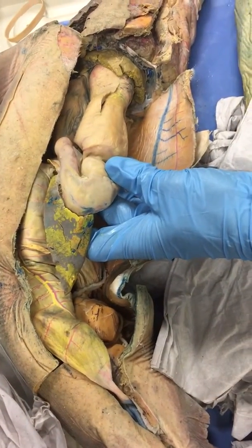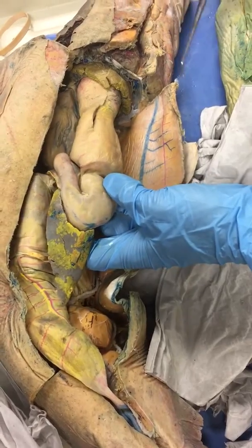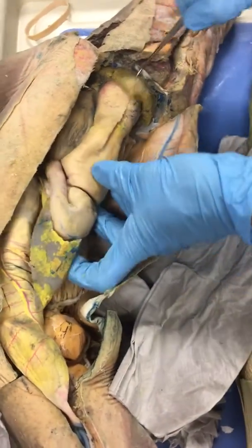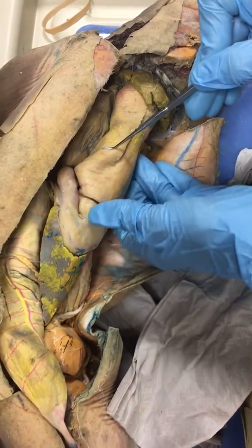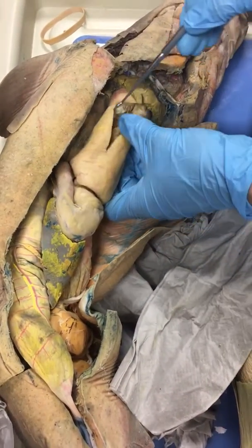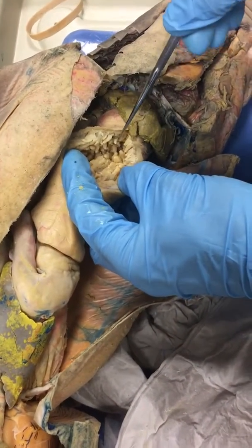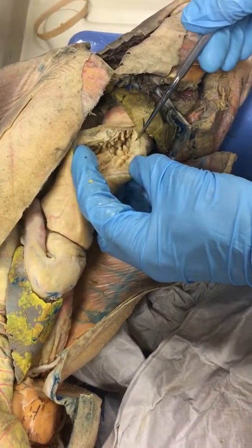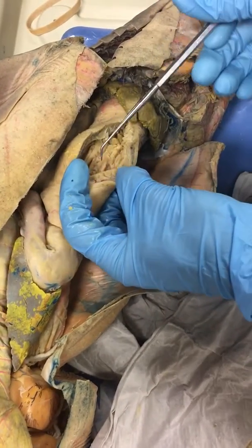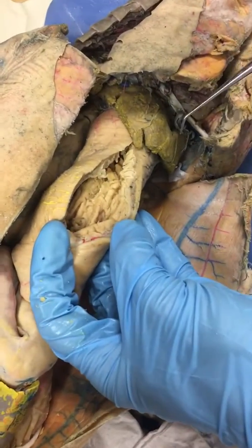Okay, this is the esophagus. This is the stomach. You really can't tell where one grades into the other without looking on the inside. The inside of the esophagus has papillae, little fingers. And the inside of the stomach has rugae, which are folds. They look really quite different.